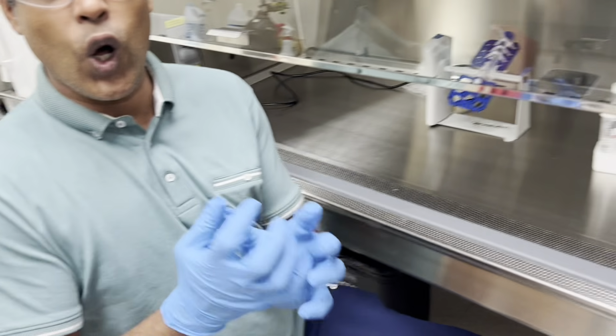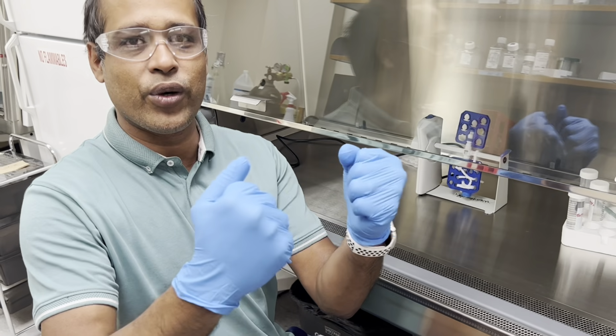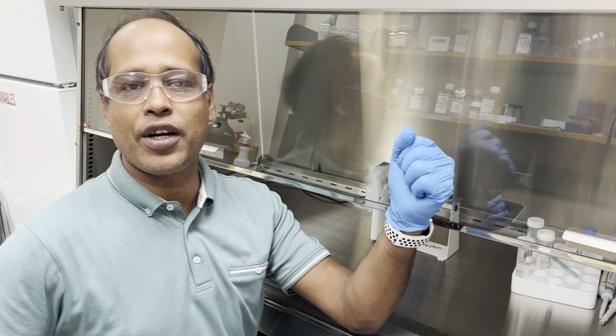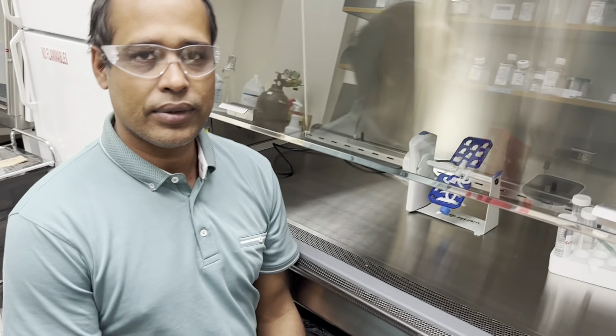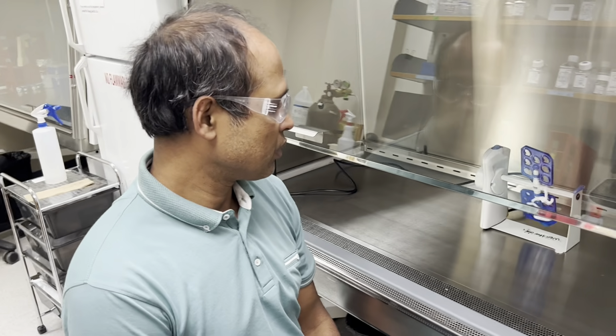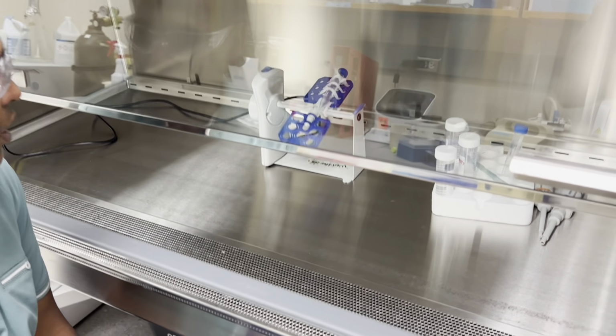Otherwise we could use all those solutions together and then finally we could just separate 1 milliliter for the BSA and 7 milliliters for the remaining part. You got it? Yeah. So the PBS will take care of the acid later on. We don't have to neutralize the HCl at all right now. So once the buffer is in, it'll stay at 7.4. So now this process is going, the activation.